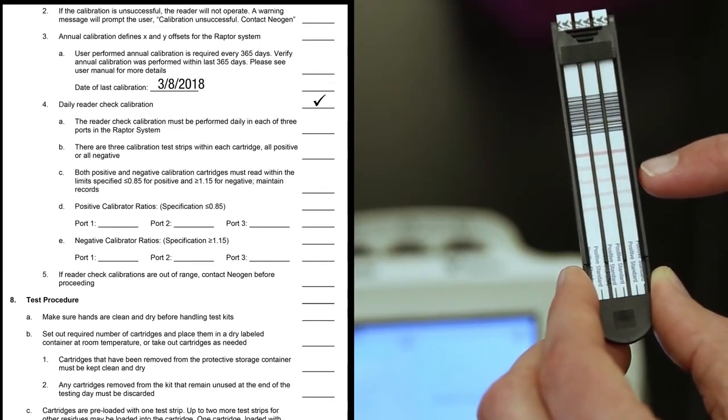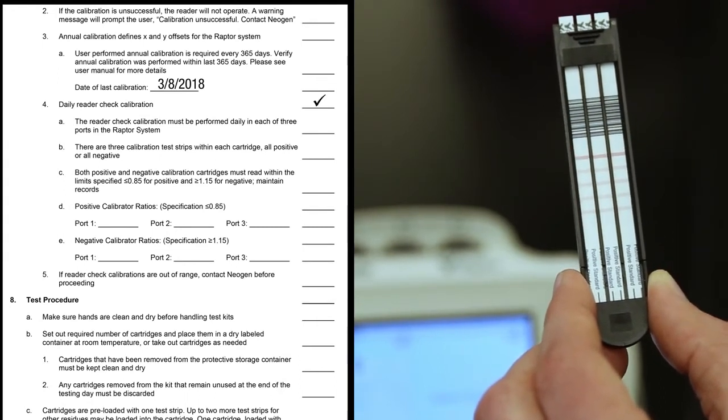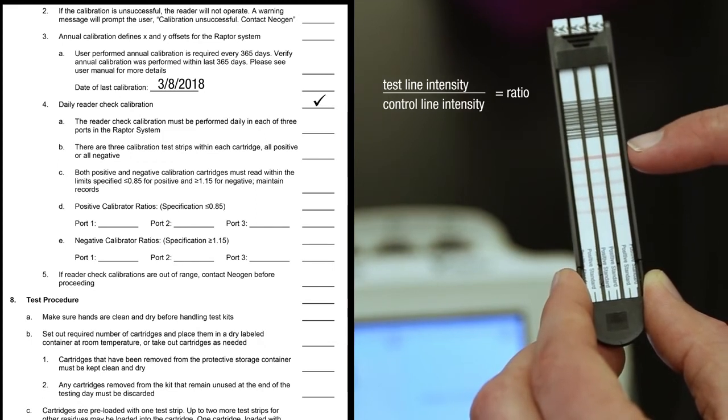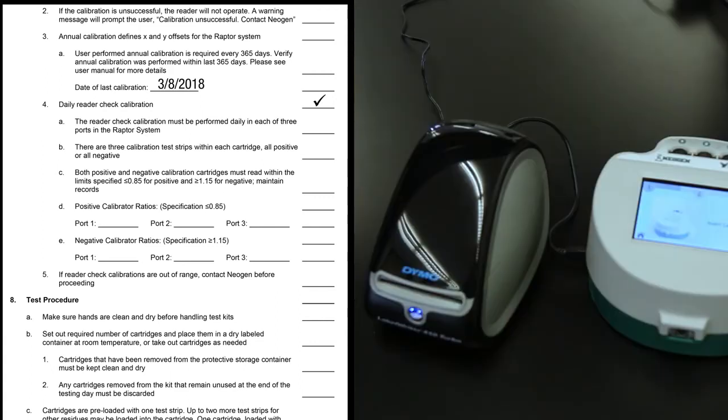Each cartridge has 12 total test lines, which are analyzed to provide a combined ratio. A ratio is the measurement of the test line intensity divided by the control line intensity. This provides a numerical relationship and determines a positive or negative result. The positive calibrators must produce a ratio less than or equal to 0.85 for each port.